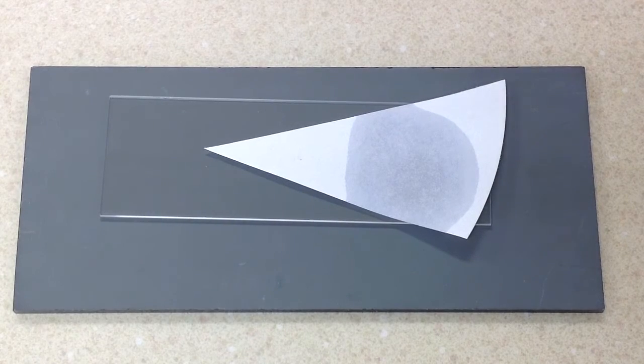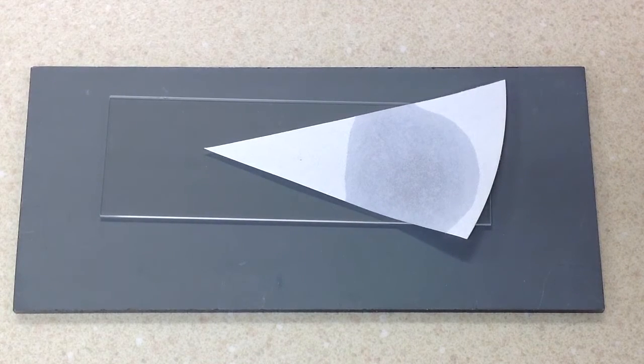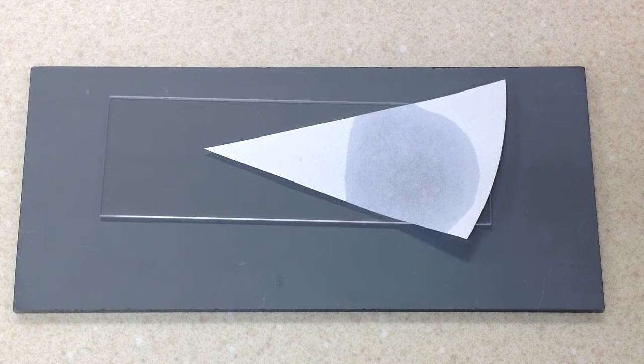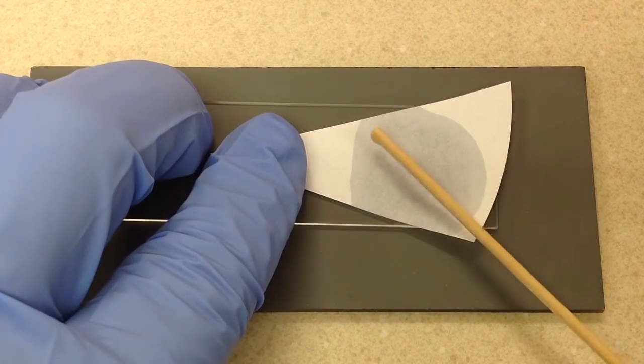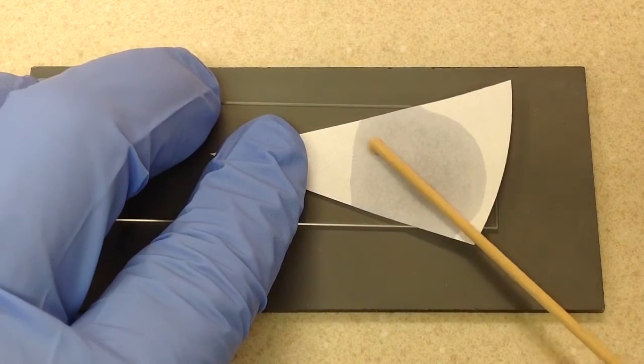Anyway, let's go on here, and I will start with my Klebsiella. Once I smear it on - I'm just using a stick - I'm going to smear a bunch on here, and you have to read it within 20 seconds.